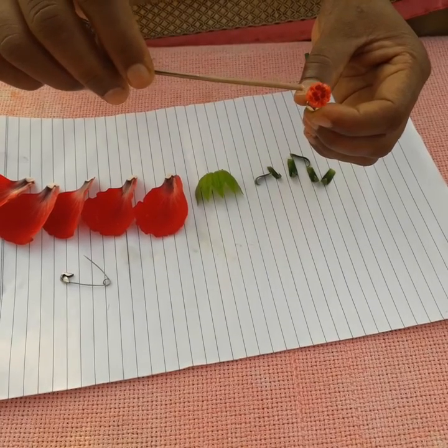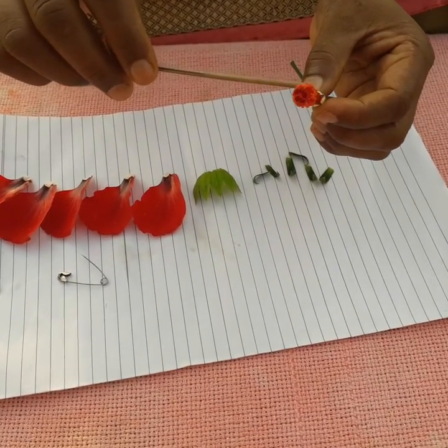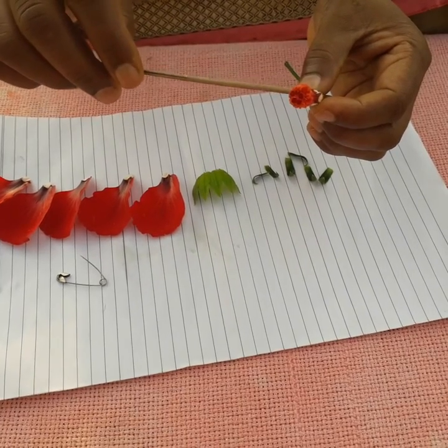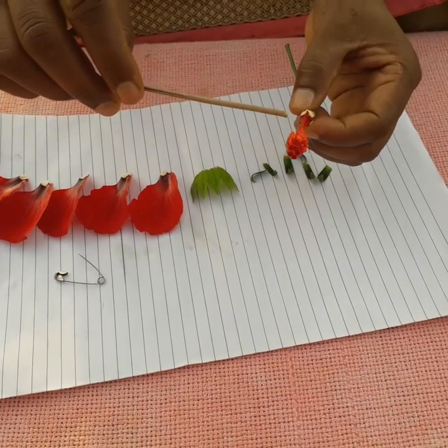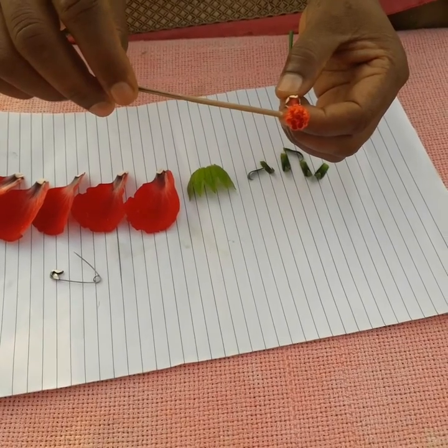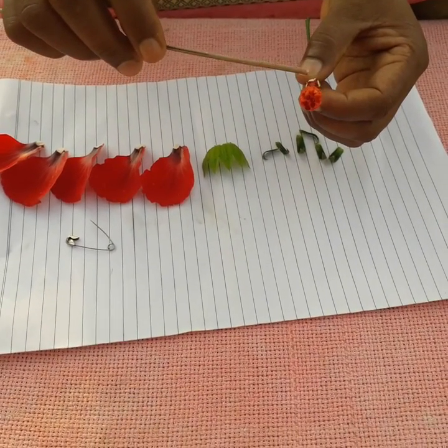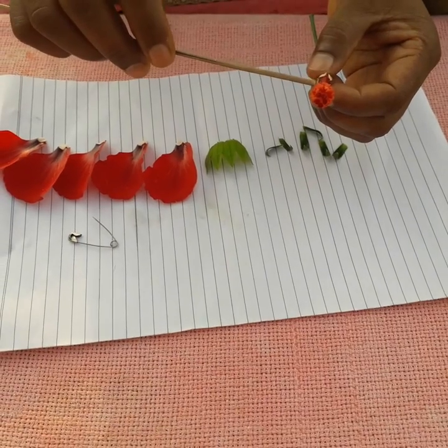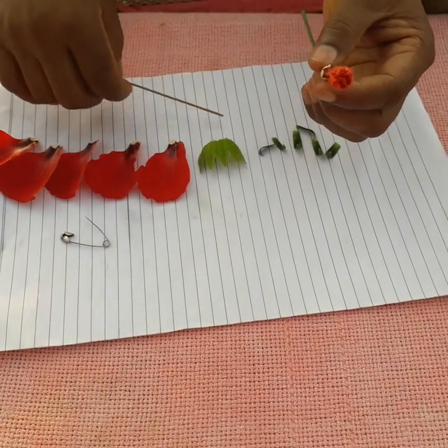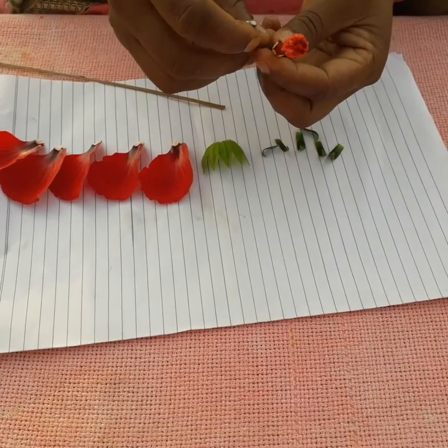The third whorl — here you can see this part — this is the stamen. In this stamen you can see a number of filaments growing from it, and having a bilobed structure, as I have already shown in the diagram. That bilobed structure is known as the anther. The anther and filament together are known as the stamen. Here I take out the stamen.